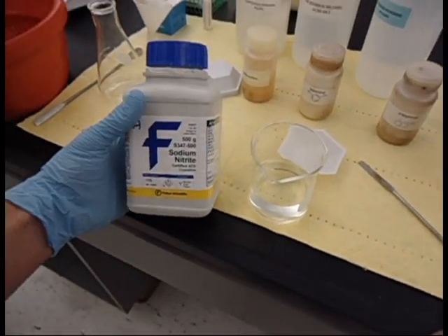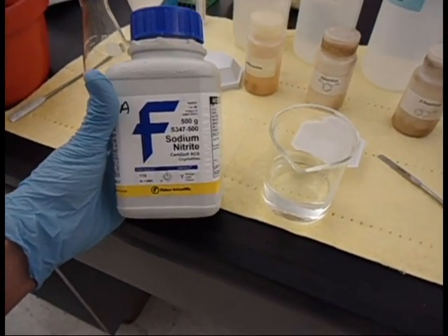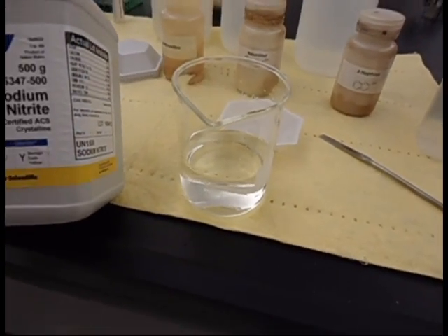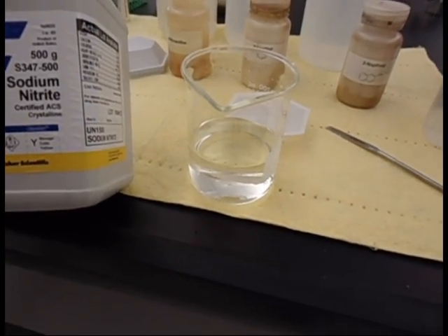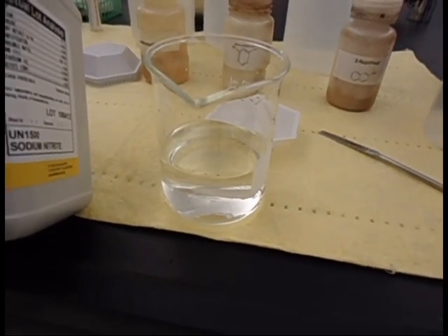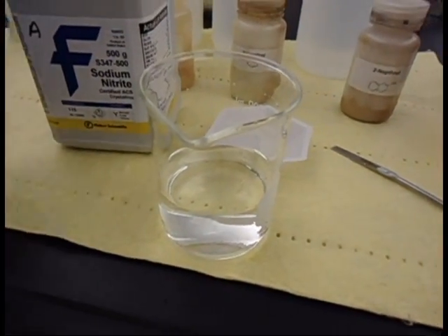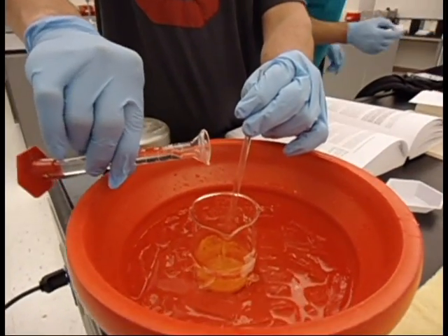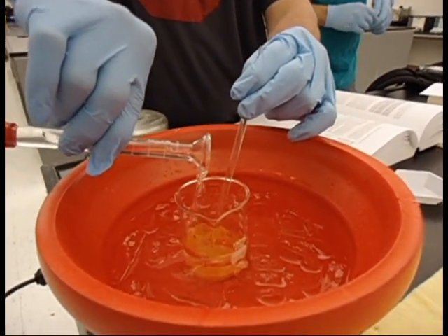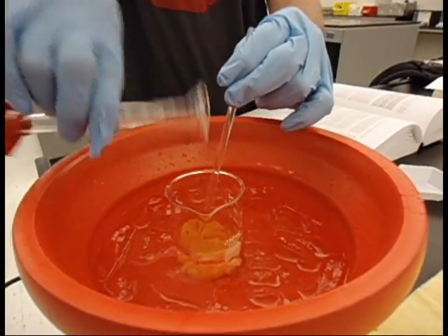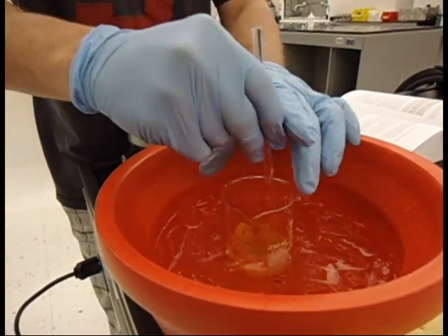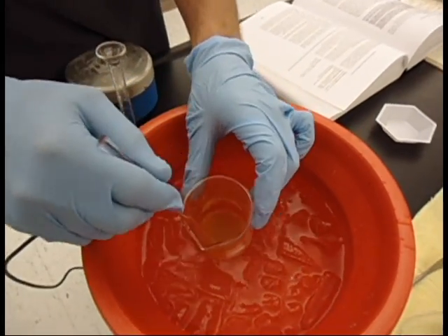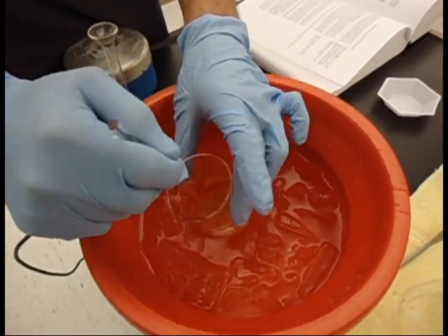This was not included as one of the original ingredients. This is sodium nitrite, and we prepared a solution of one molar sodium nitrite in deionized water, which will be used in the next step. Now we're adding 10 milliliters of one molar sodium nitrite that was freshly prepared, and we're just going to stir that in there nicely until it gets a nice solution.